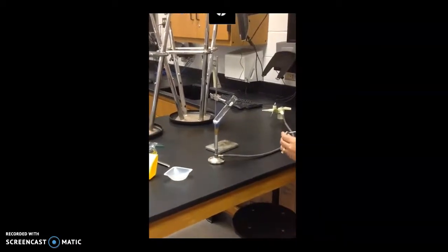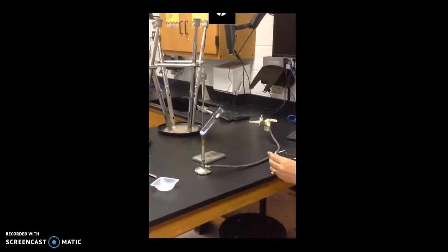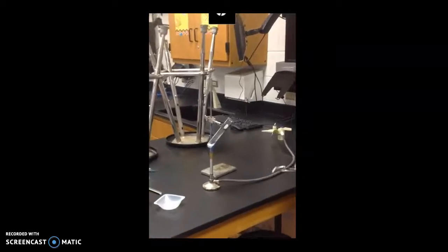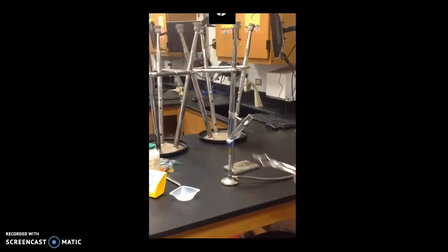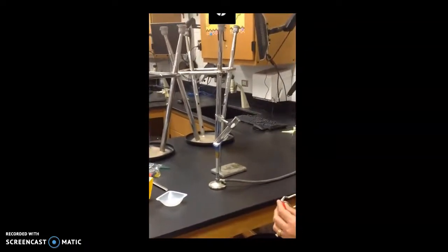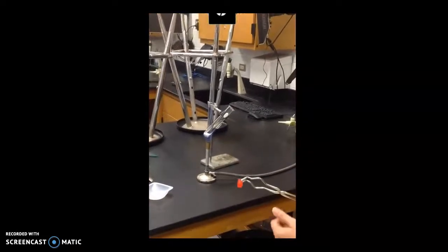It will just take a little while for it to melt, just a little while again. The potassium chlorate is a white powdery solid. And we have Mr. Gummy Bear. I chose red, no specific reason.